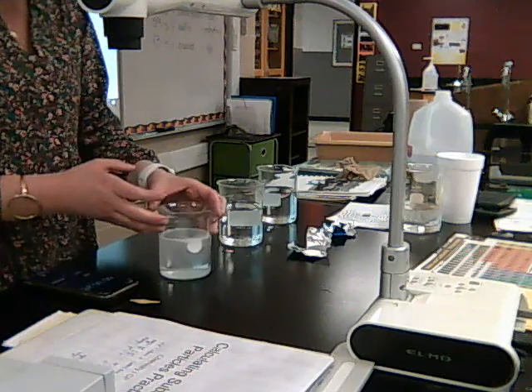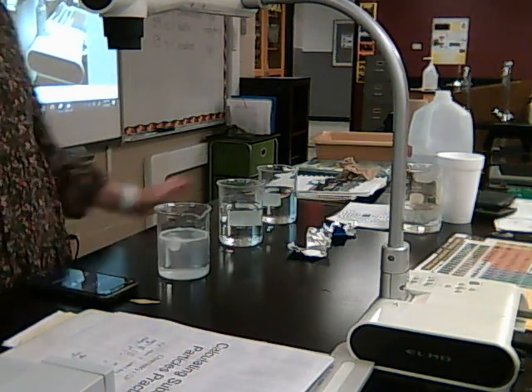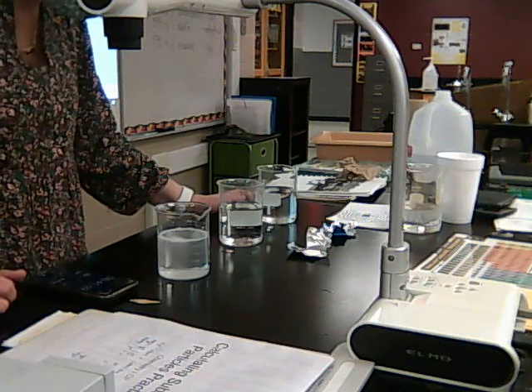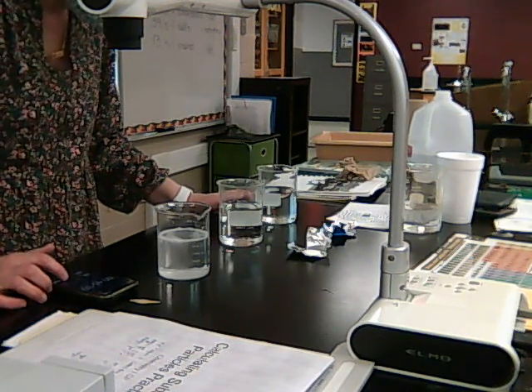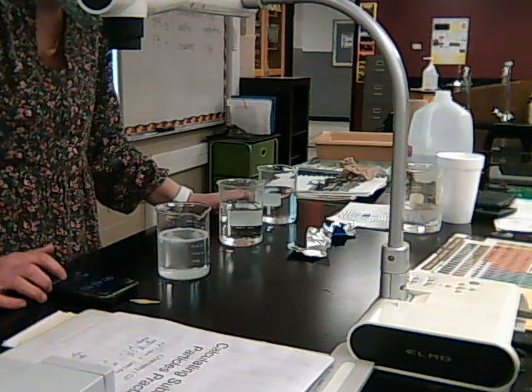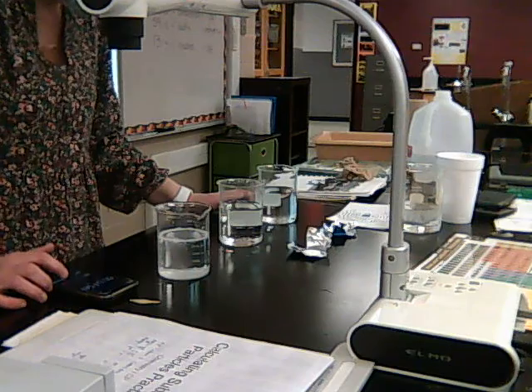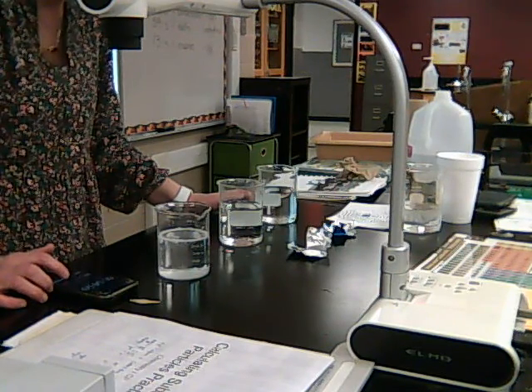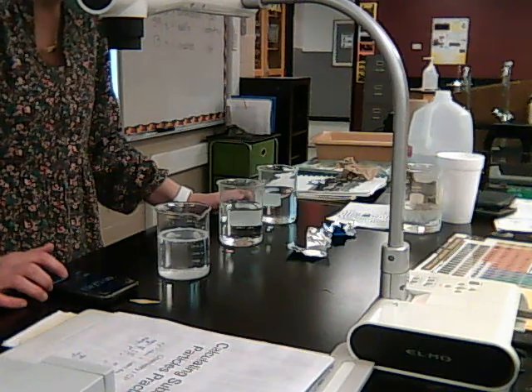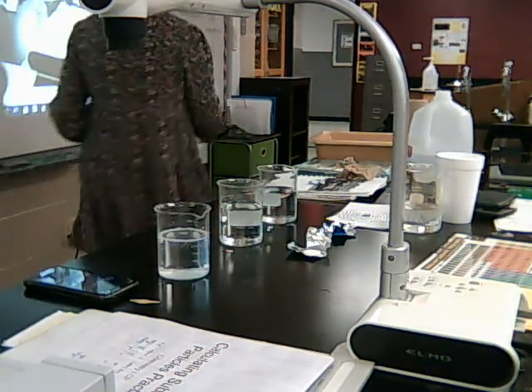Okay, it just floated up to the top. You can see it right there. It's not going yet. Almost, but not yet. Okay, so that's 59 seconds.